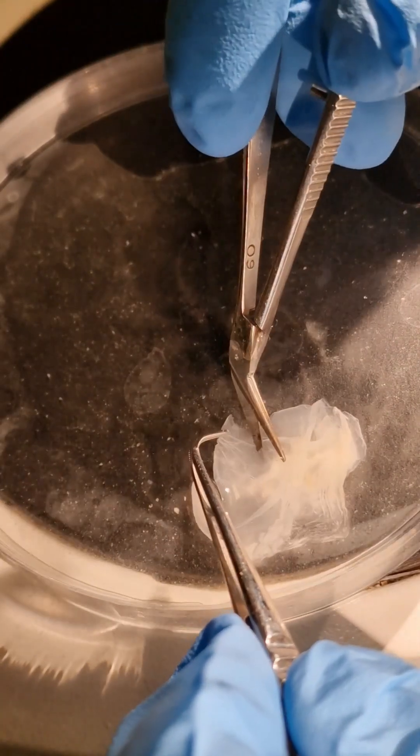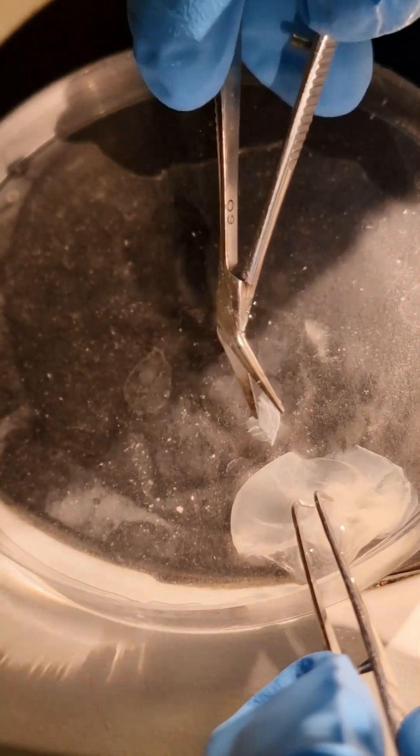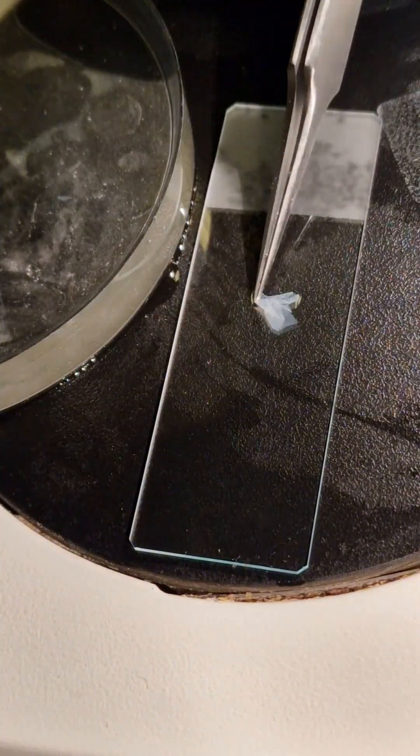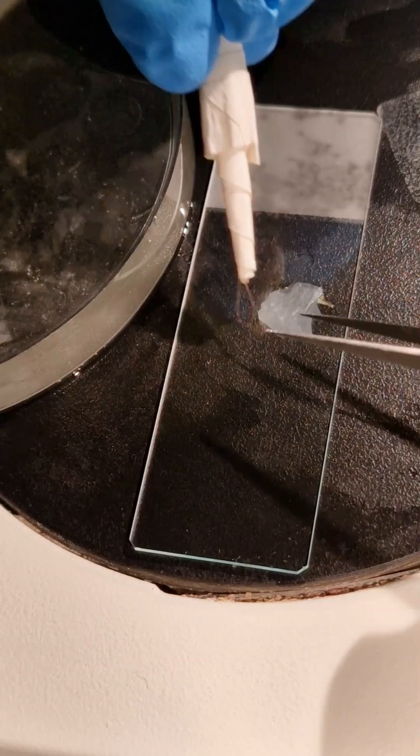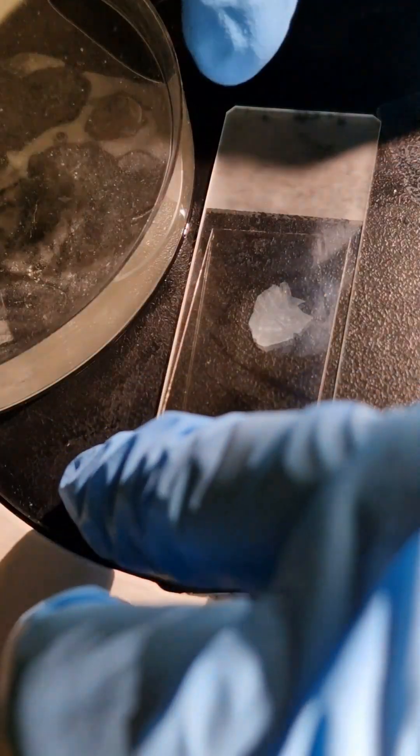Now that I have finished cleaning this piece, I am proceeding to cut a segment of it and we are going to be able to stain this with special dyes and put it underneath the microscope to see if we can find these amazing cells if fertilization was successful.